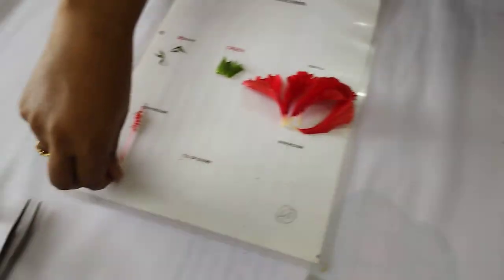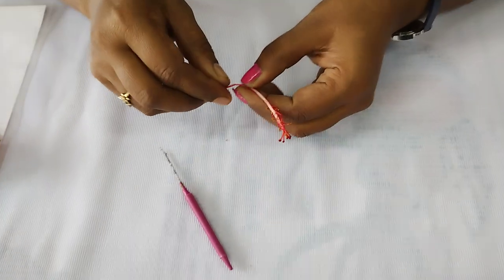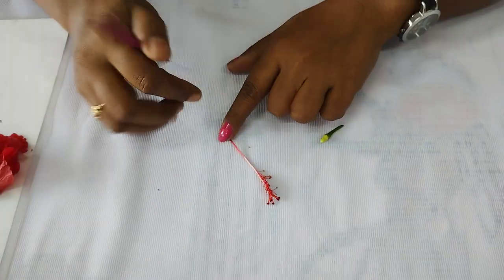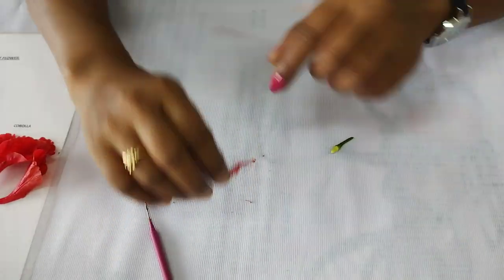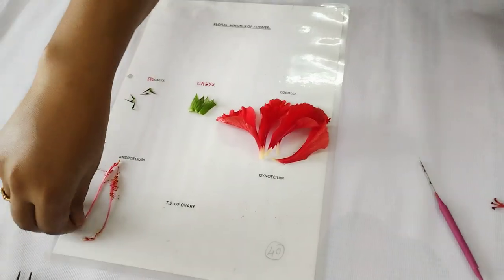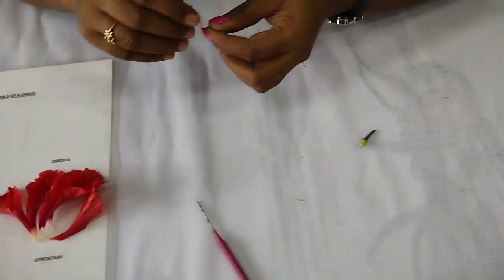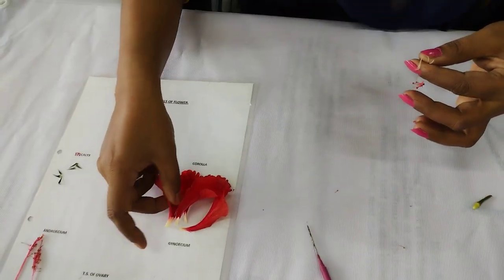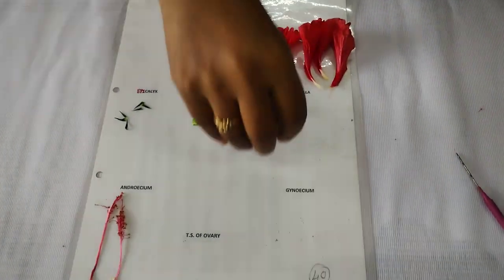Now you have to separate the male and female parts. This is the androecium, the male reproductive part. And this is the female reproductive part, which is the gynoecium.